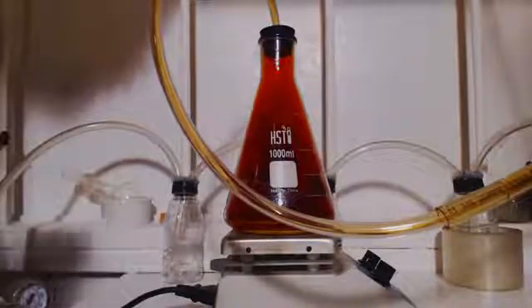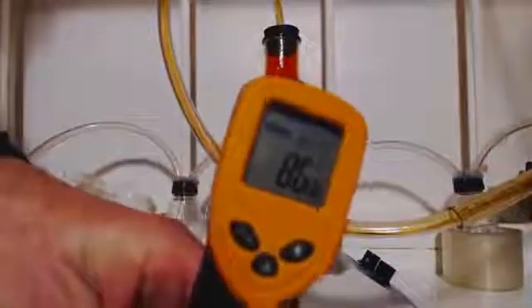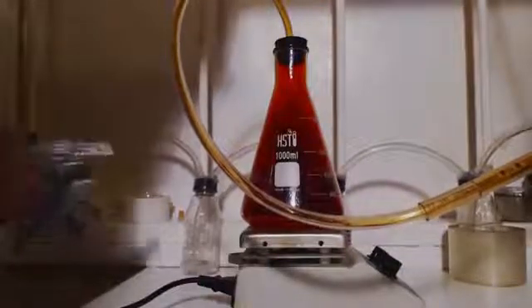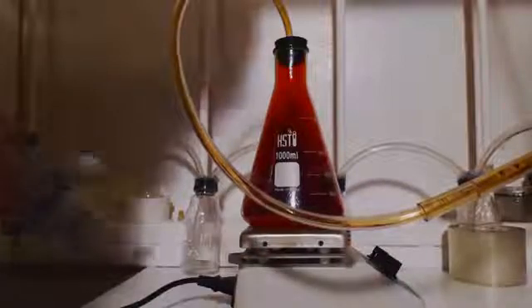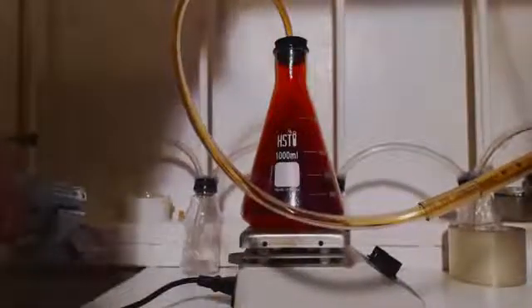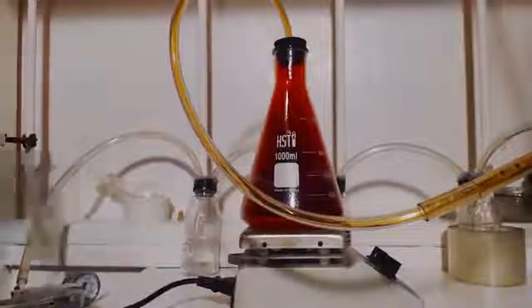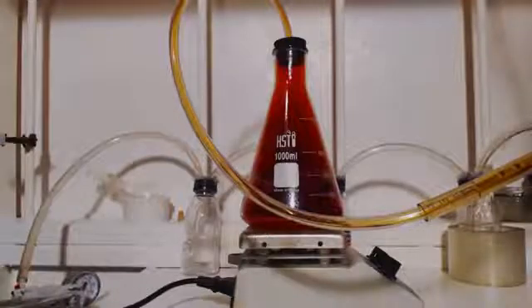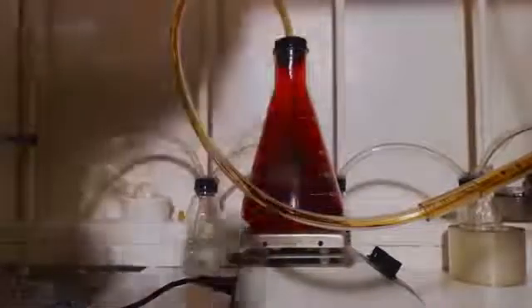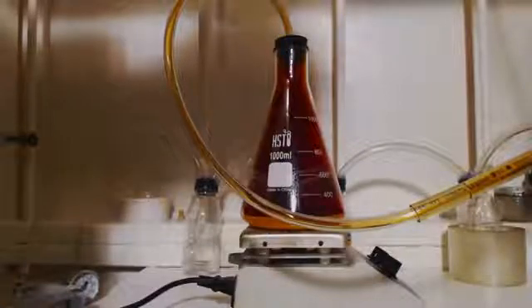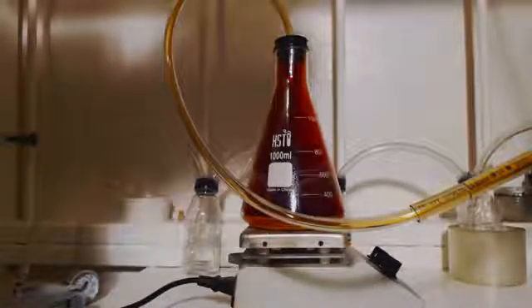This has been sitting here for a while. I turned the heat on in the hot plate. 85 degrees. I actually turned the fume hood off. As long as I pump this every once in a while, I can barely smell it. So it's always best to have the fume hood on if you have one. It's just a waiting game now. I just got to wait, keep making sure it's hot. When it gets done, we'll see what goes from there.